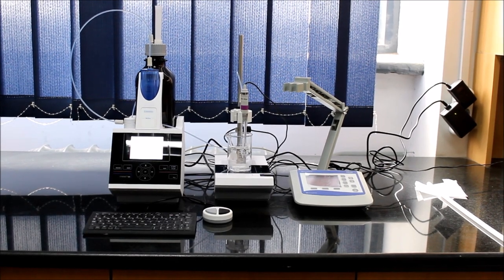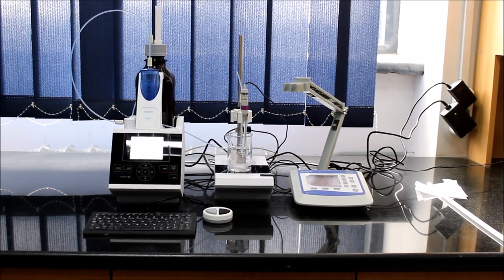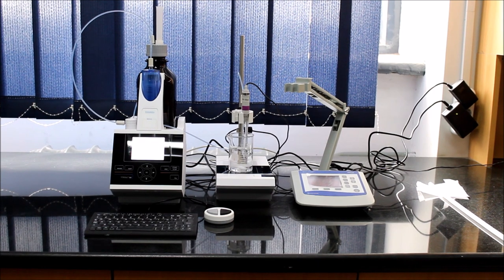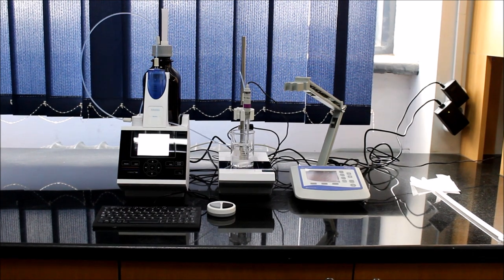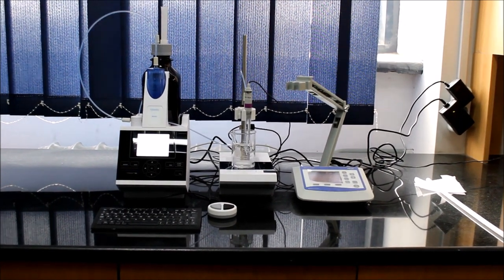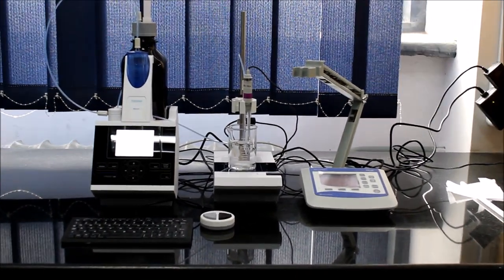Hello students! In this short tutorial I will introduce the autotitrator machine and explain its basic mechanism, after which a sample titration will be shown to ensure that you understand how to use the machine correctly and effectively.